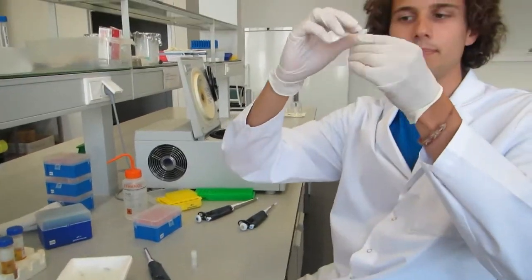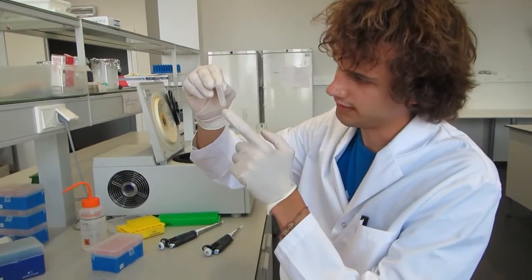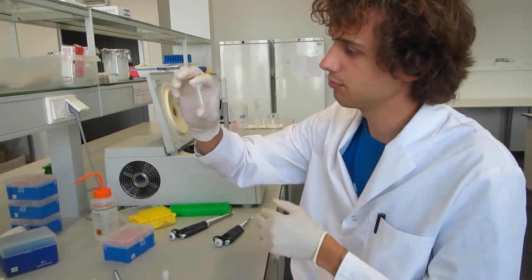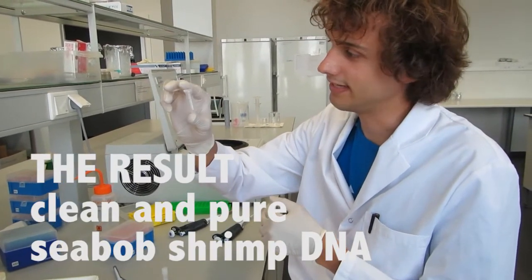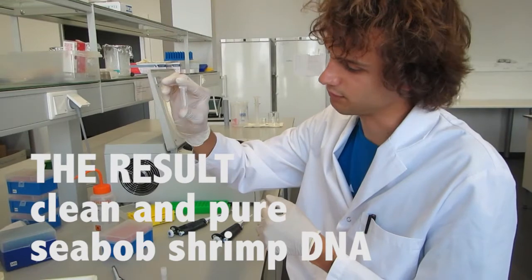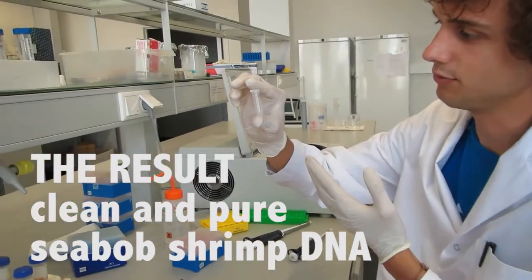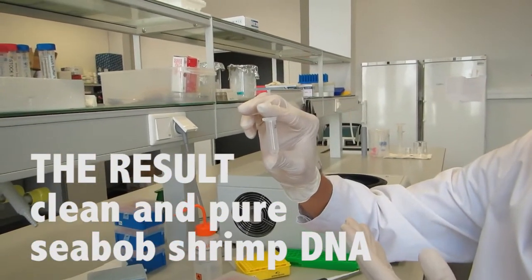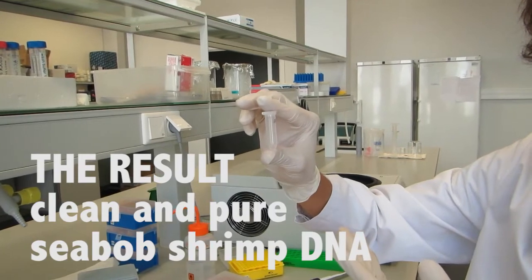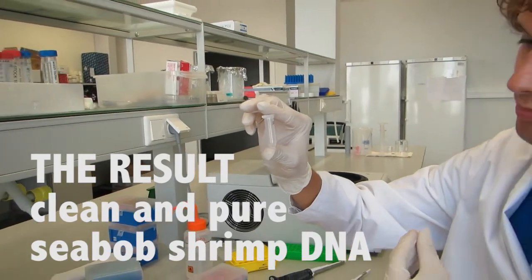Now the DNA pellet is dissolved in the water. In this tube we have the clean and pure DNA of the seabob shrimp of our sample. And this we can use in the future for PCR amplification, for taxonomy, for population structure.